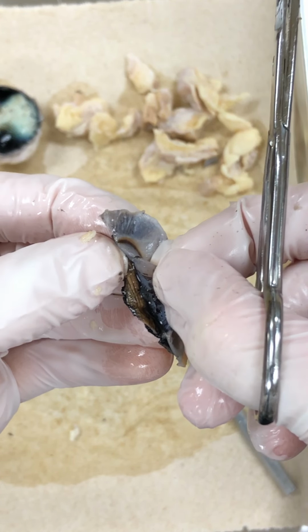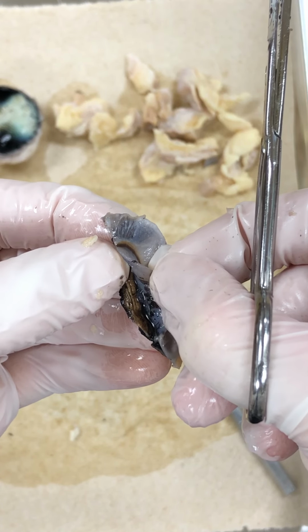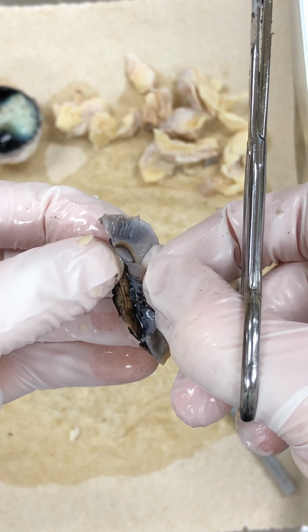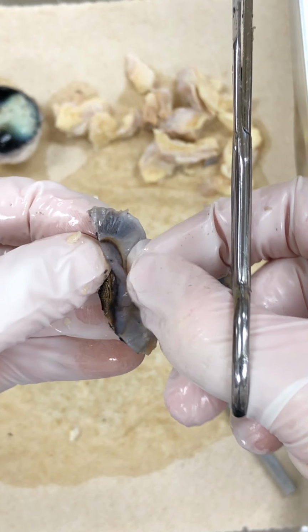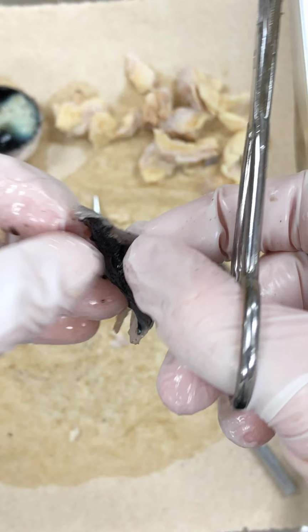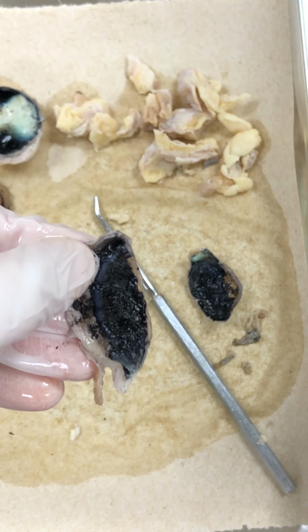Now anteriorly on the iris, there are 2 layers of smooth muscle. Okay, autonomic nervous system controlled muscle. And that's going to allow the pupil to dilate or constrict depending on how much light is coming through. Okay, so 2 layers of muscle on the anterior side, and then we have the ciliary bodies, these muscles back here that attach to the lens.